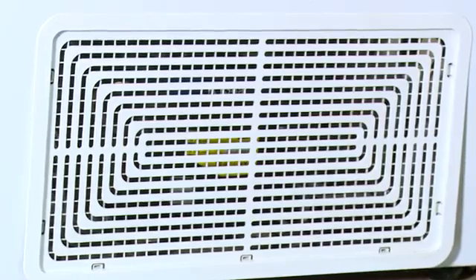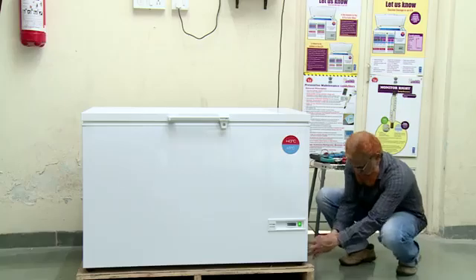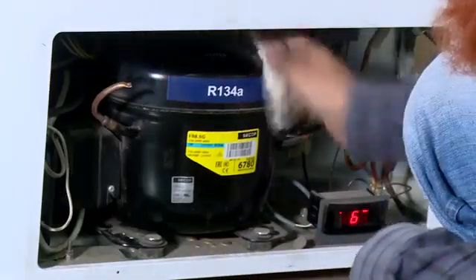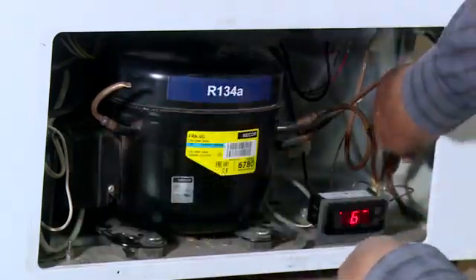Be attentive towards any abnormal sound in the compressor compartment. Check the compressor compartment and clean it thoroughly. Loose connections and cable conditions should also be checked.